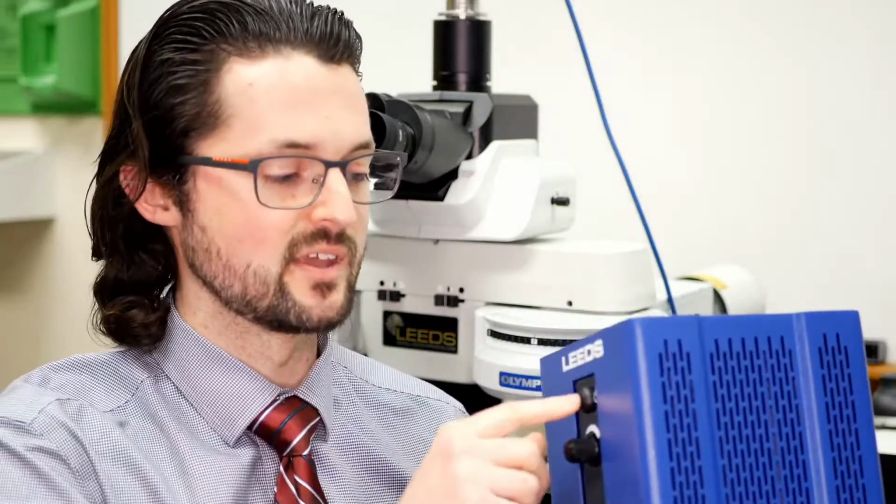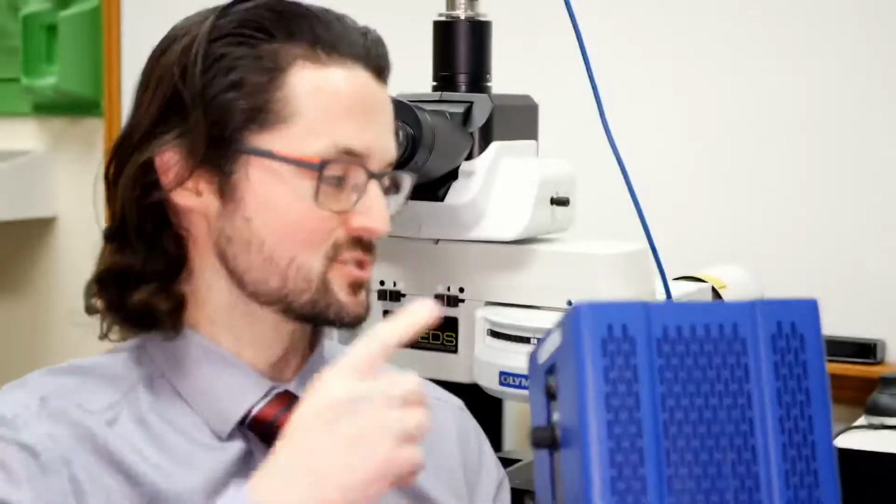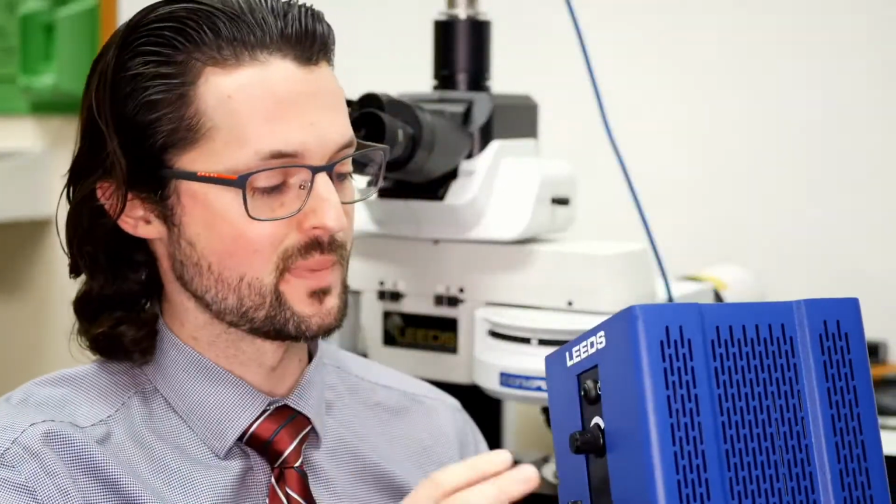One of the cool things about the LED is, one, I didn't plug it in. I'll do that in a moment, and I'll show you through the comparison scope. But the cool thing about the LED is that unlike the halogen light source, it has constant color rendering at all intensities. So as you increase the intensity of the light source, it gets brighter, but it doesn't get whiter or cooler in color temp. And as you decrease it, it doesn't get warmer in color temp. What that means is when you're working on a trace comparison and you're changing magnifications, moving up, moving down, you can just freely adjust the intensity of the light without changing that color rendering.